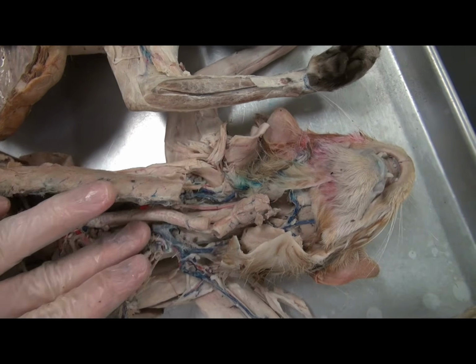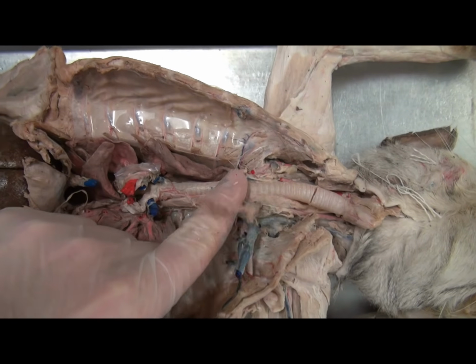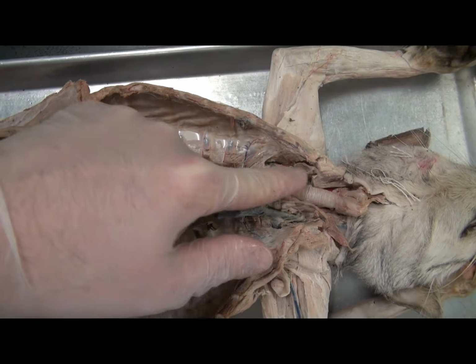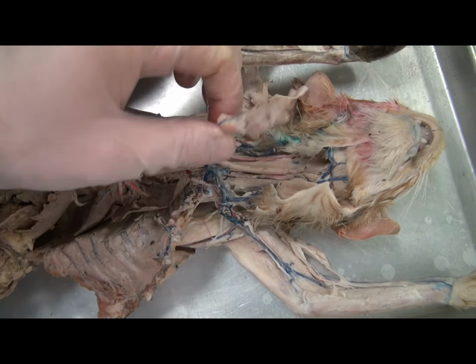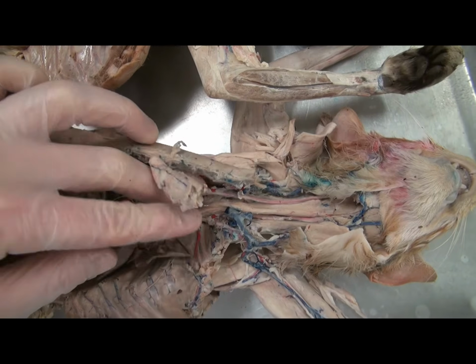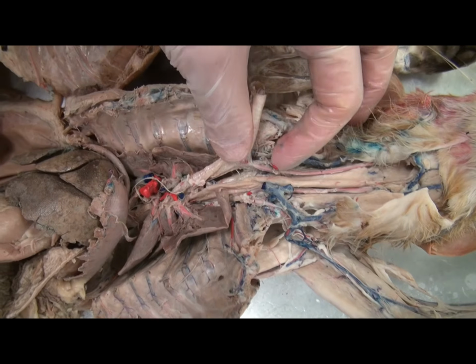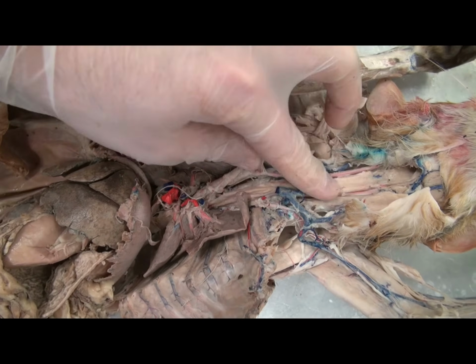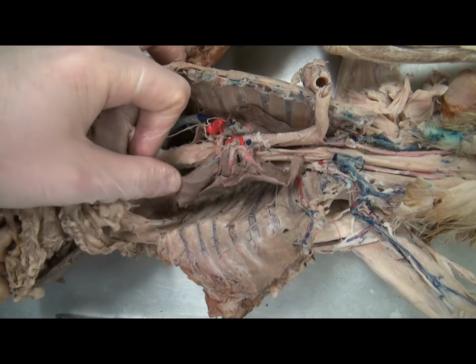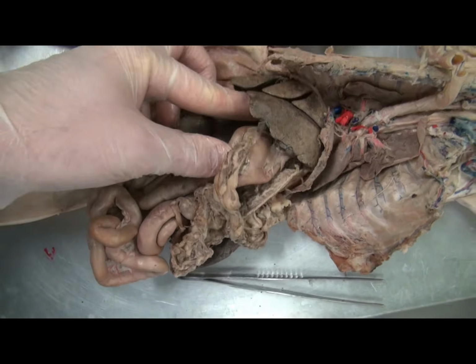The trachea is the anterior passageway through the throat, and so one can see these cartilage rings, which the trachea has, but not the esophagus, and the trachea is the anterior structure. If one were to remove the trachea, then one would see the posterior tube, the esophagus. And so there are two tubes in the throat which are kept separate. The anterior tube is the airway, the trachea. The esophagus then passes behind the heart and lungs, and then will pass through the diaphragm and then enter the abdominal pelvic cavity.